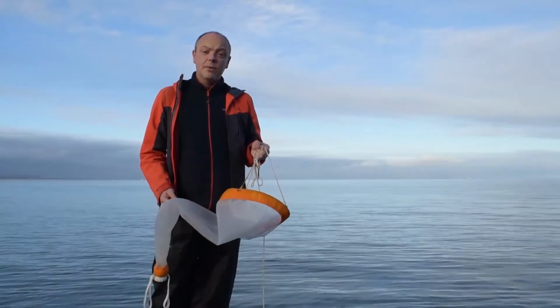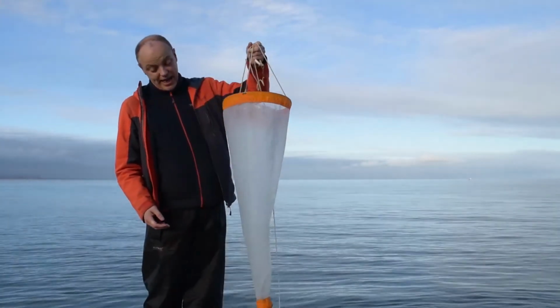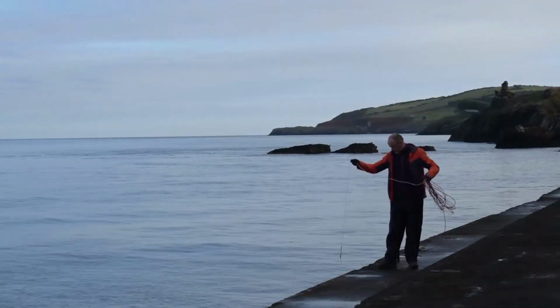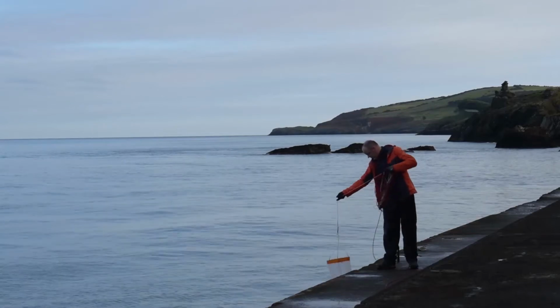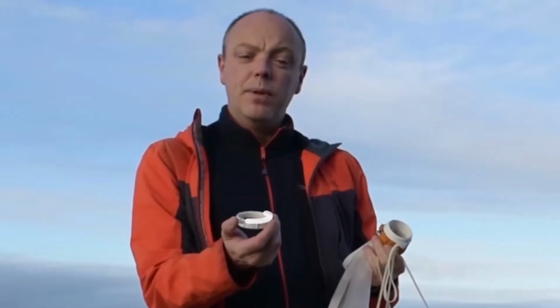So when we're out collecting animals from the sea, we'd normally use something like this. And this is a specialized plankton net. It's basically just a big bag of mesh which we pass through the water. The water gets filtered through and anything that's in the water will collect at the end. So we've got this little filter at the end. We can open that up when we take it out and see what we've caught.